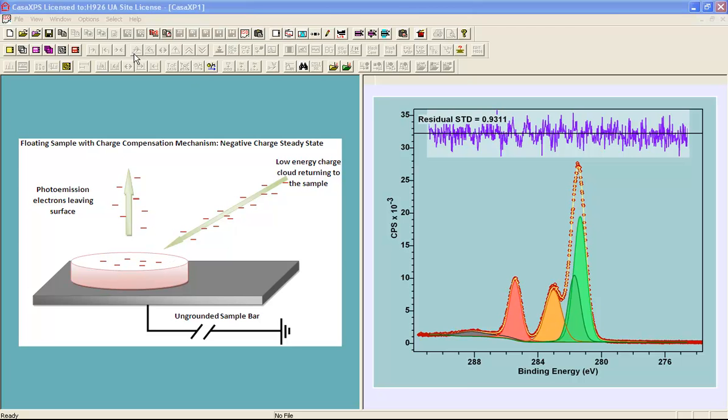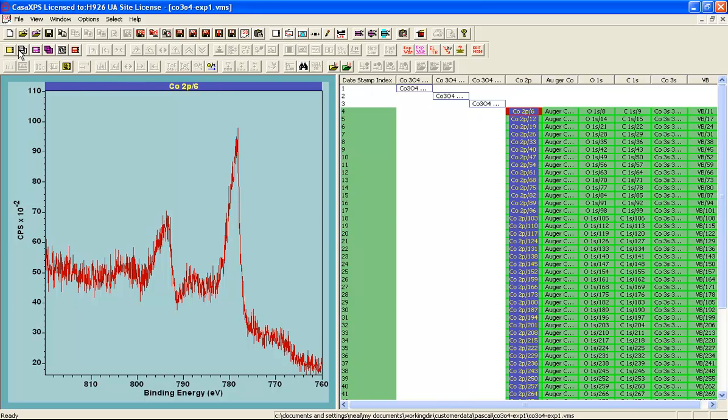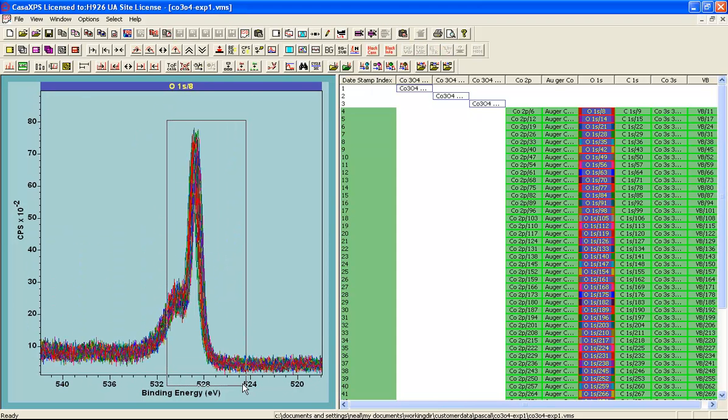As an example of a perturbation to the state of a sample, the file that you see here is a set of measurements from a cobalt oxide, and a set of narrow scan regions have been repeated many times. The dwell time for each one of these scans is 50 milliseconds, but these have been repeated many times, so that if we look at an individual spectrum, the individual spectra look rather noisy. But if you were to take en masse all of these spectra and sum the information in these data, then you would end up with a spectrum with the signal to noise that would be typical for a measurement of cobalt oxide. It's easier though to see the influence of the charge compensation if we look at the oxygen peak.